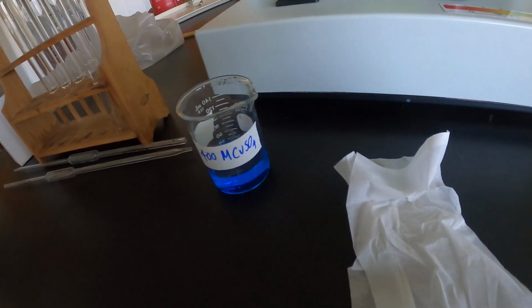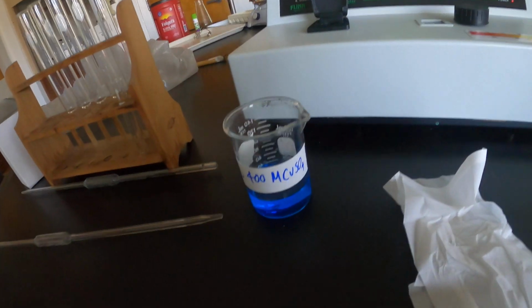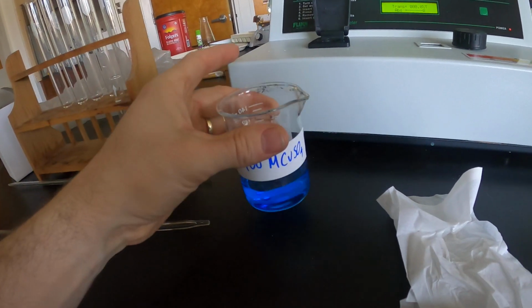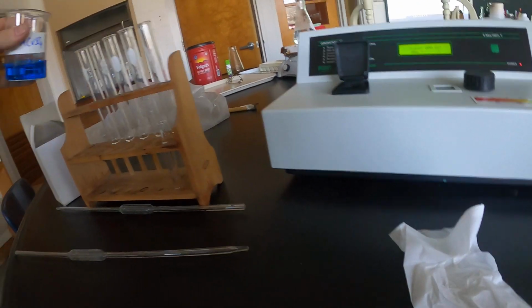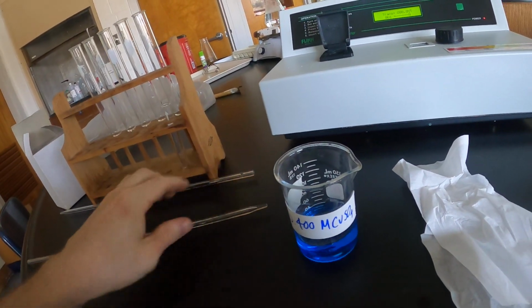One of the first steps in this one is going to be to make some dilutions, right? So we're going to create your calibration curve and your calibration standards here by diluting this solution in half in each successive dilution. So you can start with the 0.4. This indeed is your first standard solution.